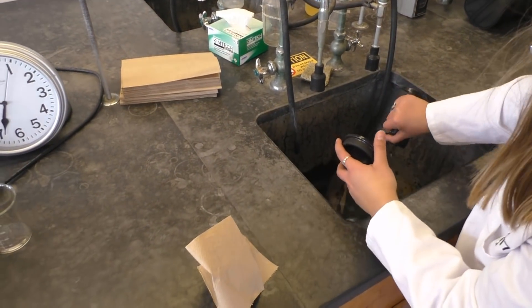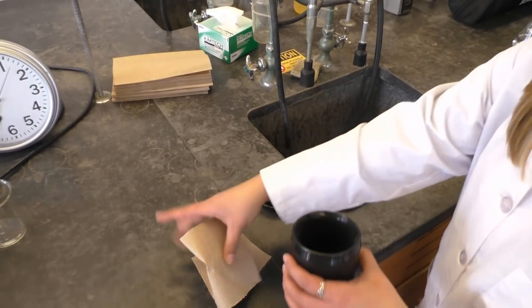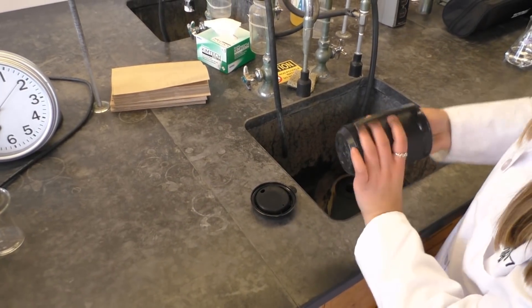Be sure to dump out and dry your calorimeter between each data collection today. All solutions can go down the drain.